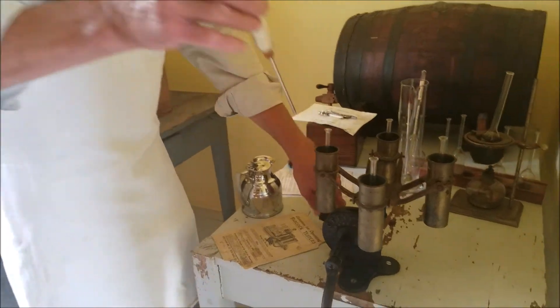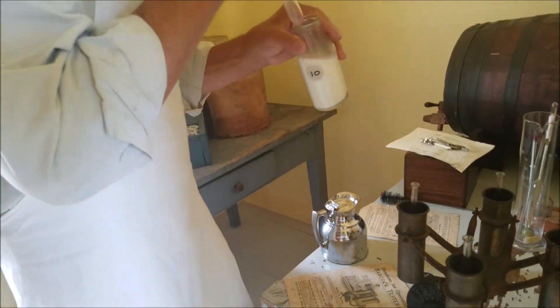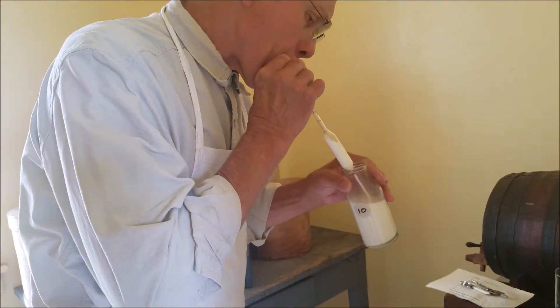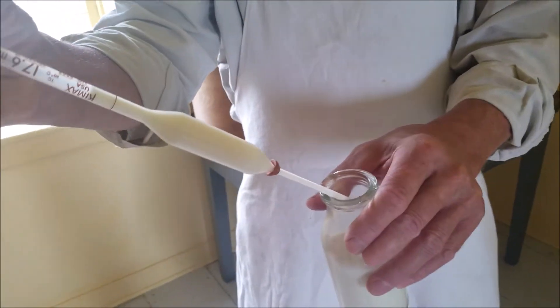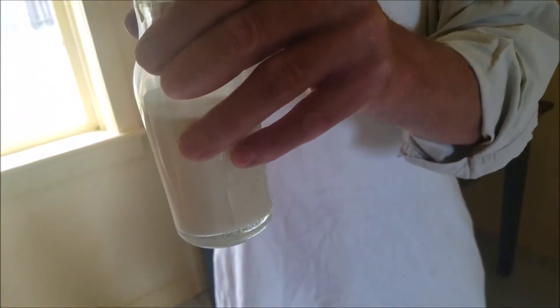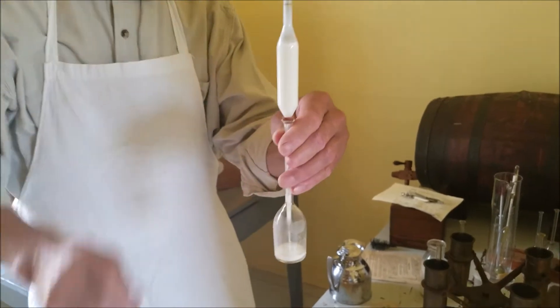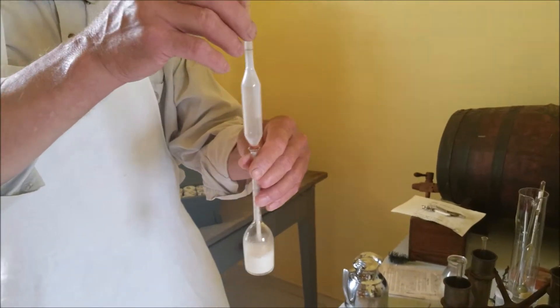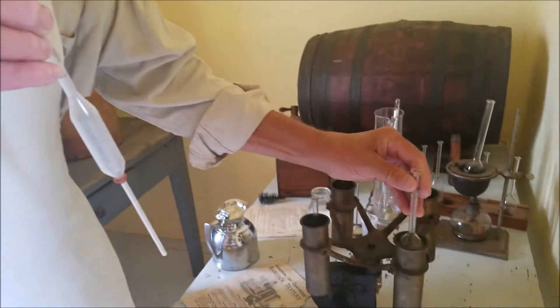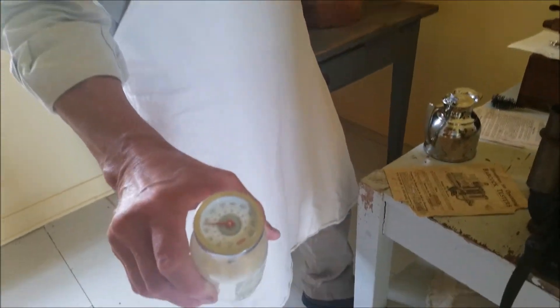What we're going to do here is take 17.6 milliliters of milk — right at the bottom of the meniscus at that line. Put it into our testing bottle. This bottle took many years just to get the right size and the right graduations. Blow it all out, make sure all the milk is in there. By the way, this milk was at 70 degrees, which is what it's called for — 70 degrees.